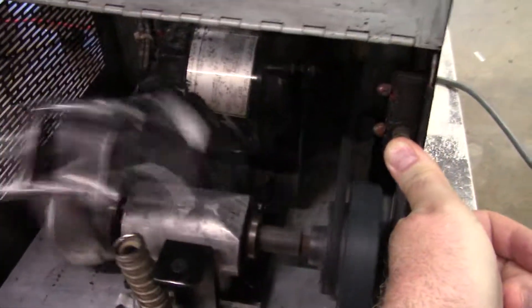There she's running. I can show it running. I just tested the timer — it also works.